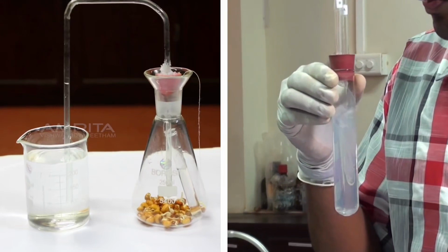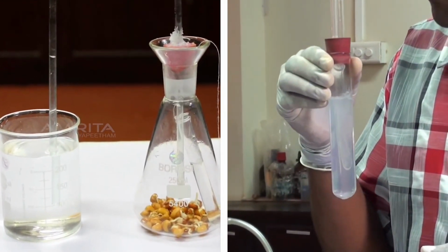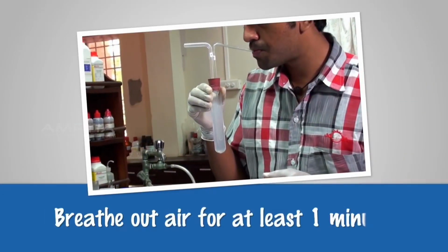So, we can conclude that both plants and human beings produce carbon dioxide during respiration. Precautions: use freshly prepared lime water. Breathe out air for at least 1 minute.